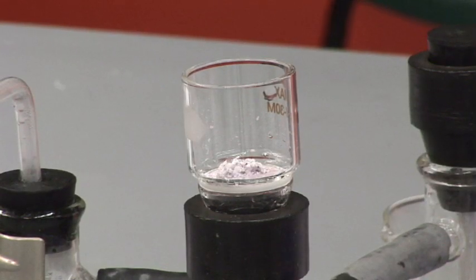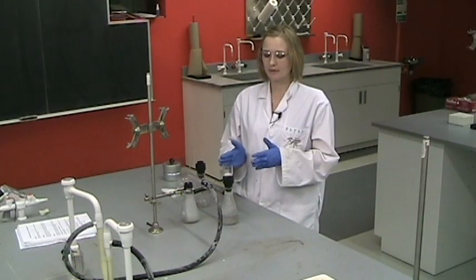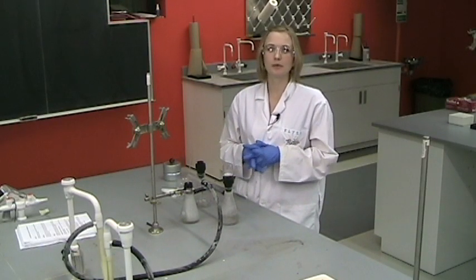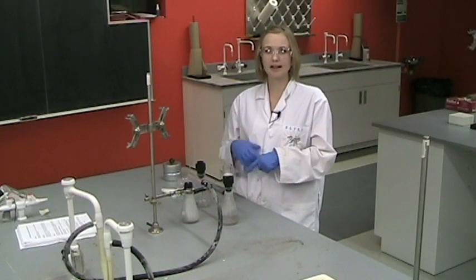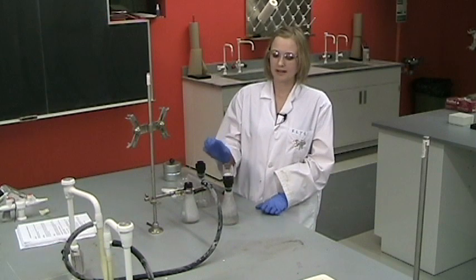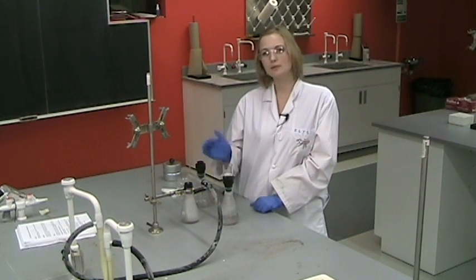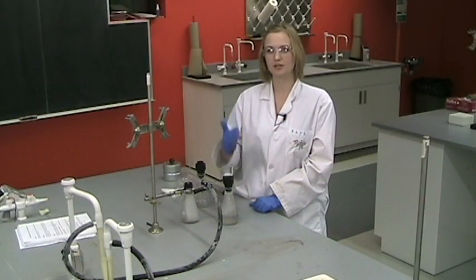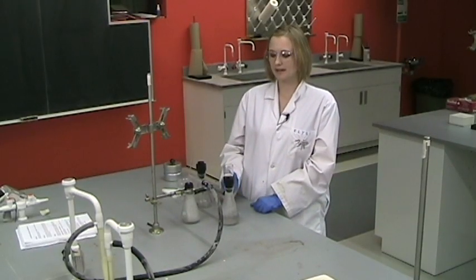At this point, we want to test that any excess silver has been removed from the precipitate. Because if excess silver is present, if the salt is exposed to light and there's excess silver, it can break down the salt even further. So you will add some water to the filter and you'll be checking the water that actually drips through the filter, drips through the salts. Ask your TA for help at this point.